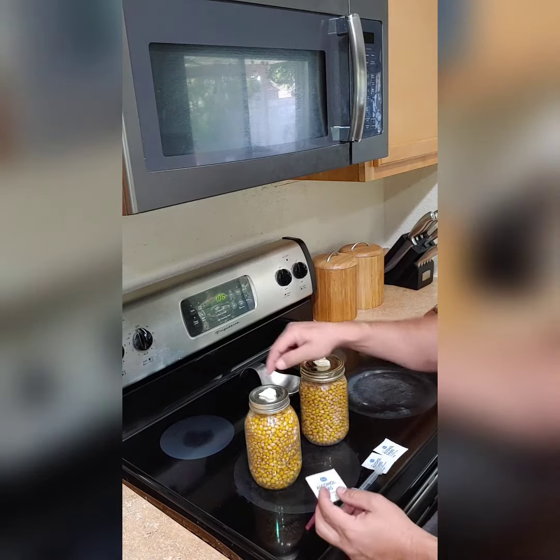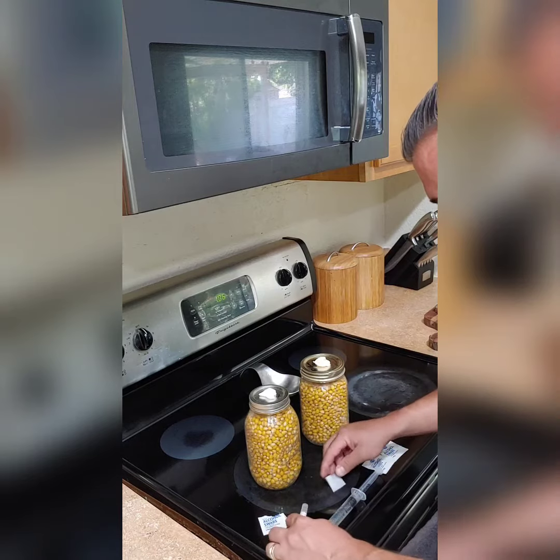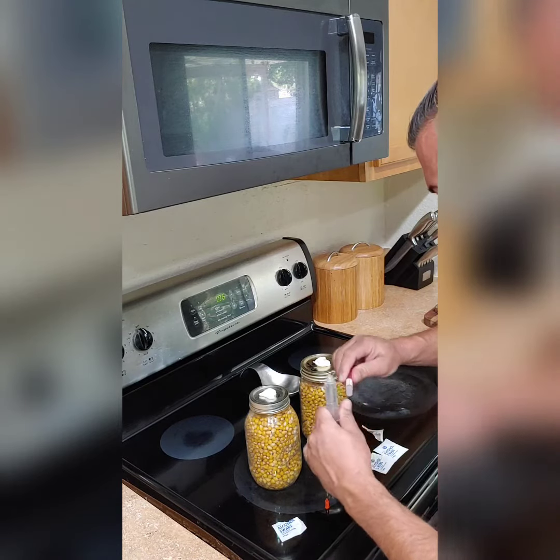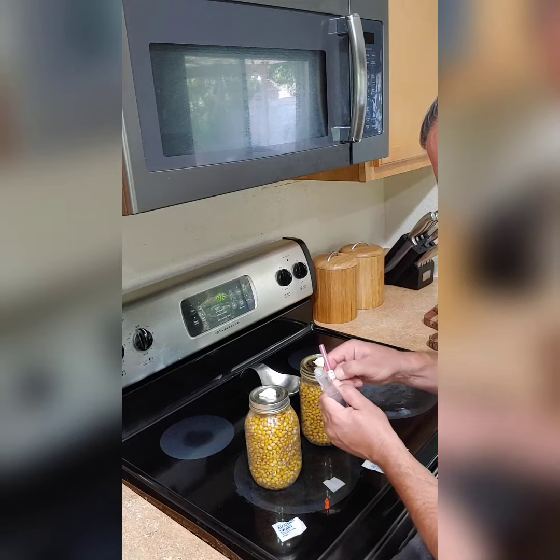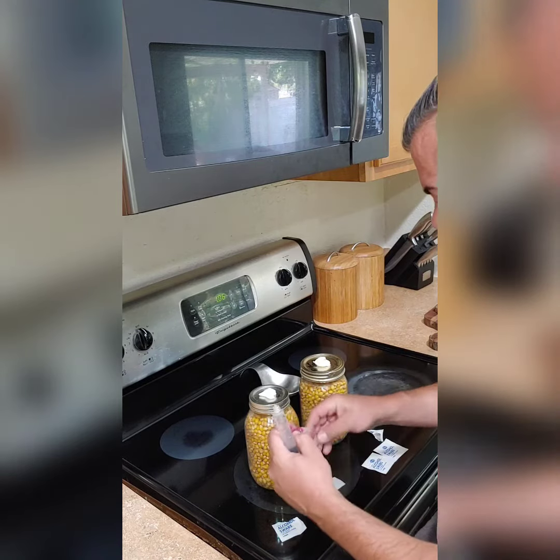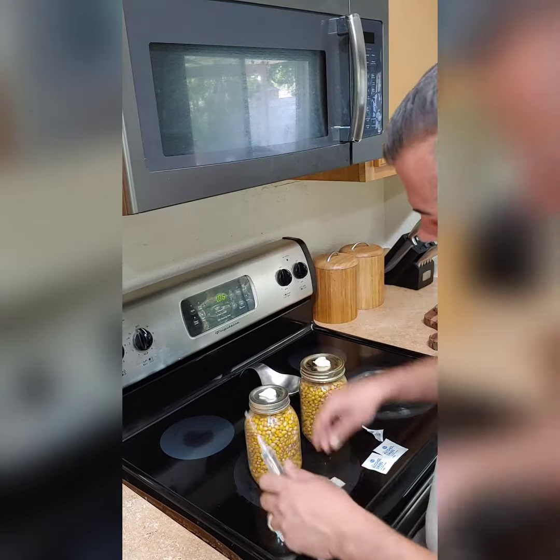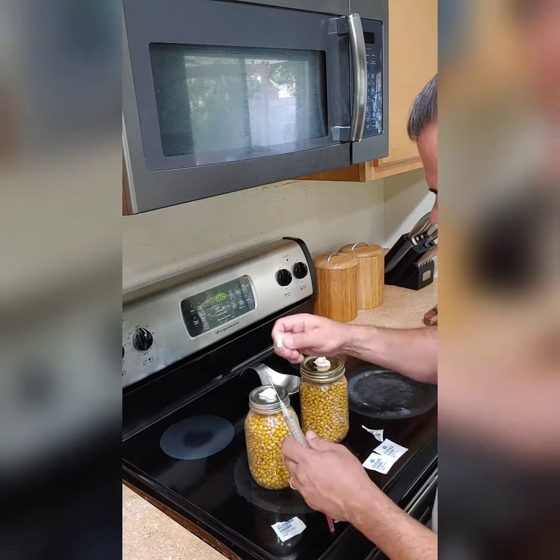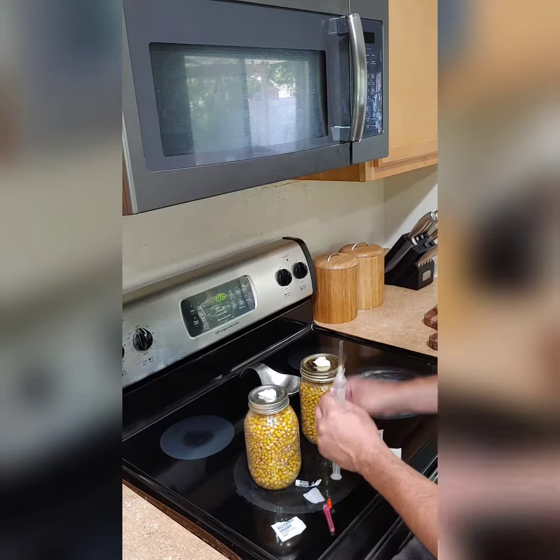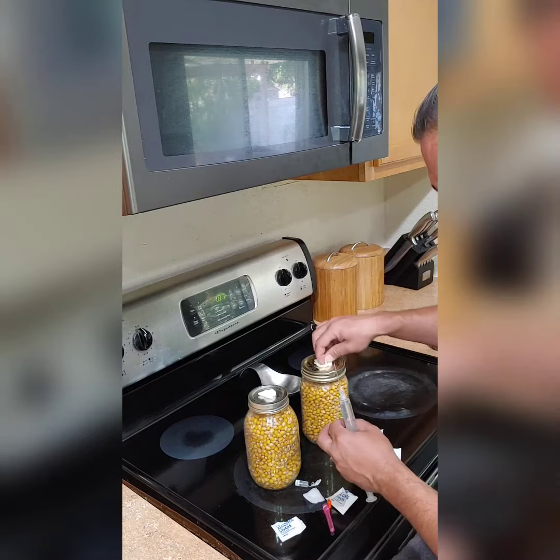So you guys need some alcohol swabs. This one came with a needle. We're gonna inject it in our port that we created the other day. What we're gonna do first is open up this syringe and get the needle screwed on. Looks like they got it taped really well. We're gonna sterilize the needle really well — we don't want to get any bad stuff inside of there. We took the time to really sterilize that popcorn in the pressure cooker to get everything nice and sterile.